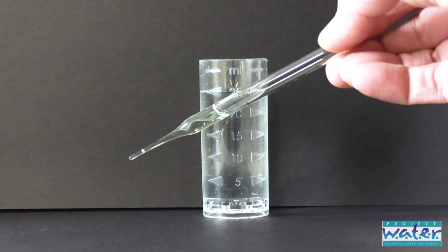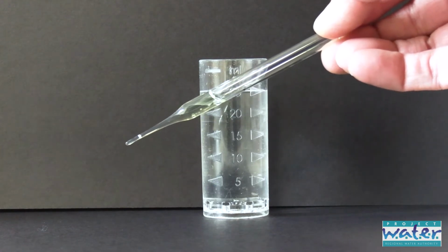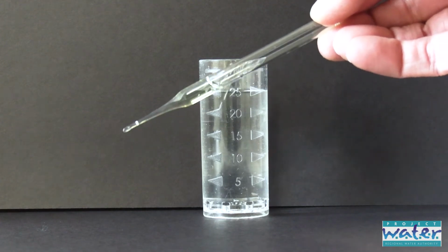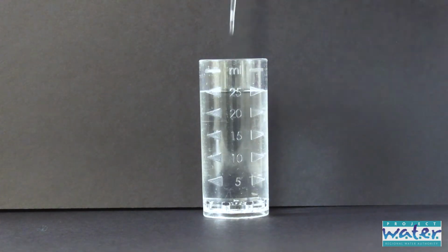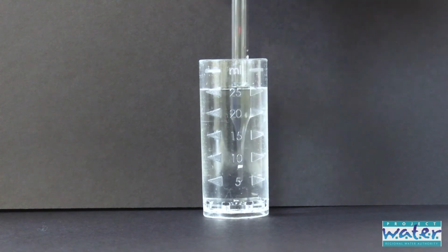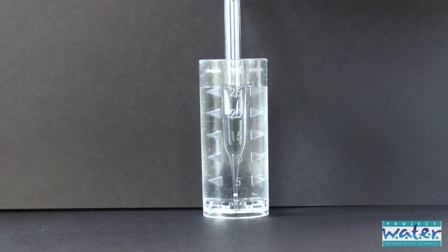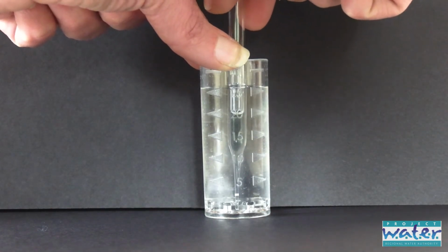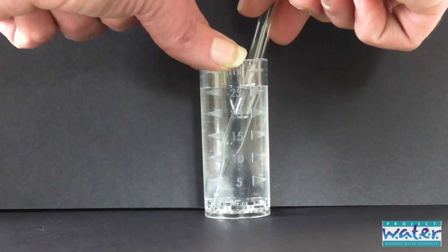For the next step, you're going to need the glass ampule with the chemical in it. Your teacher will give this to you when you're ready for this step. You're going to take the narrow end of the ampule and put it into the test tube. Make sure it's hooked into one of those dips that goes around the edge of the test tube. Hold the test tube with one hand. Make sure the ampule is straight up and down, not at an angle.